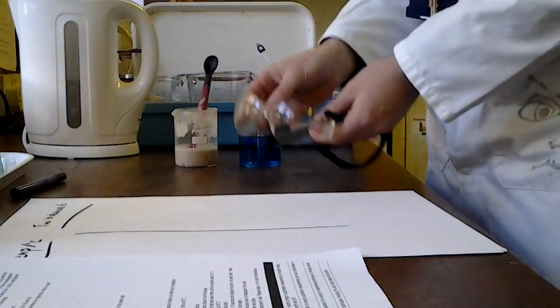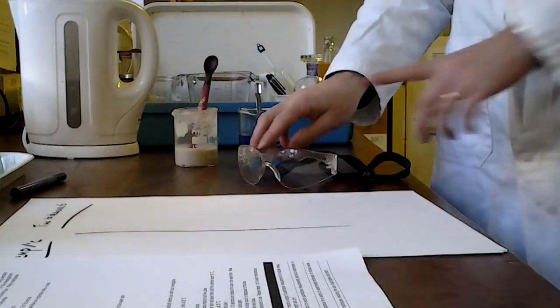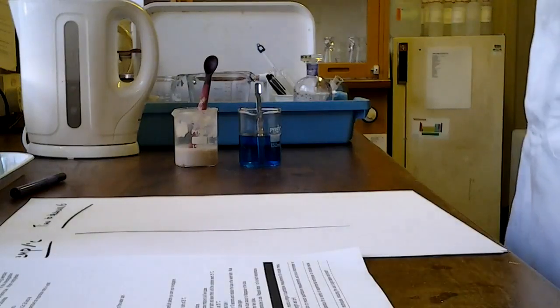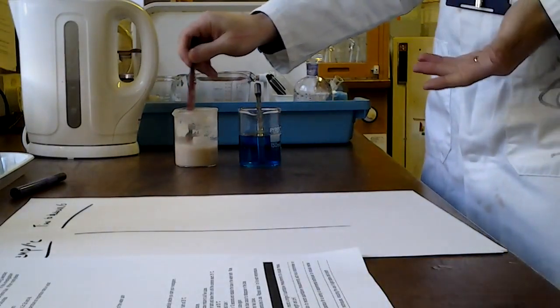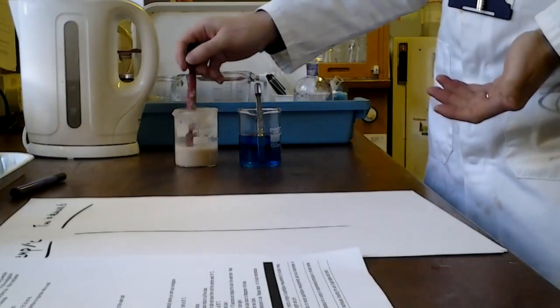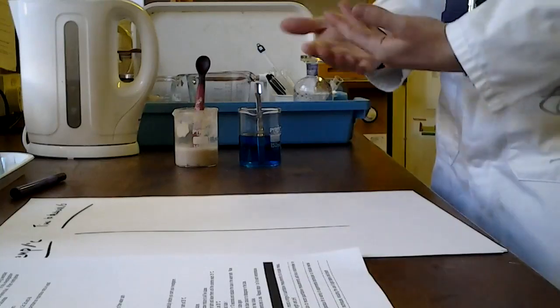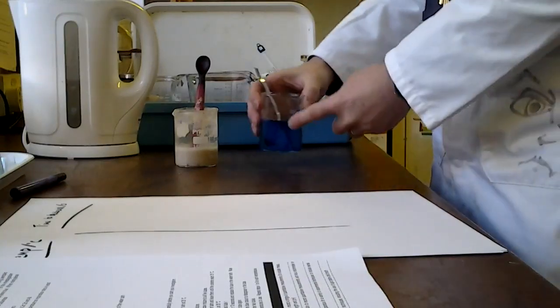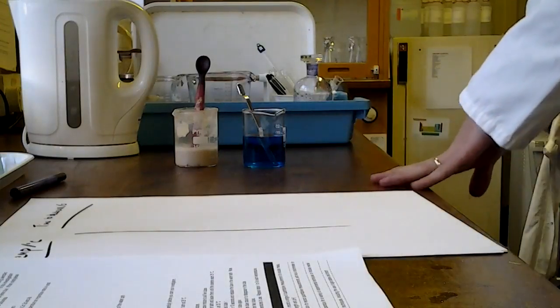So in this experiment, you're going to be using yeast at different temperatures, and you've got methylene blue. So think about your risk assessment. Obviously, eye protection as always. And yeast is potentially an allergen. It's a living organism. If it comes in contact with your skin, you don't know what's going to happen. So allergen is something you need to consider. If you get it on your skin, of course, you will wash it off. And this is potentially an irritant as well. So bear that in mind when you think about risk assessment.